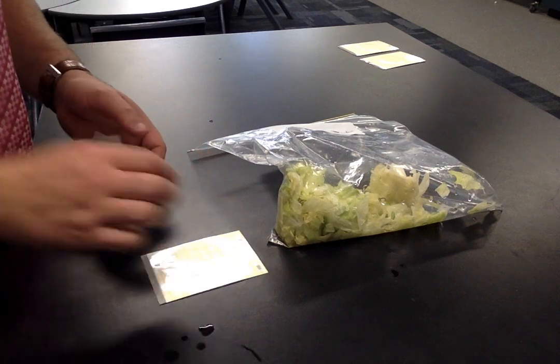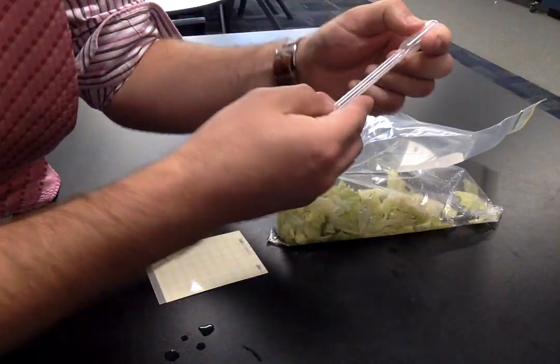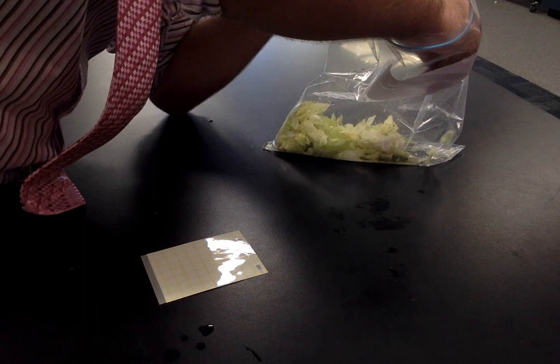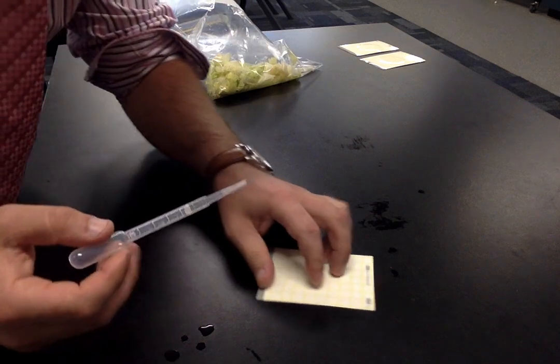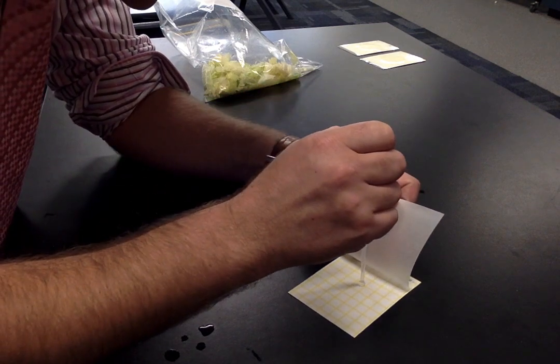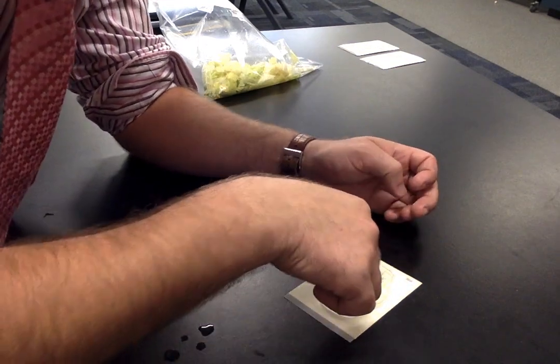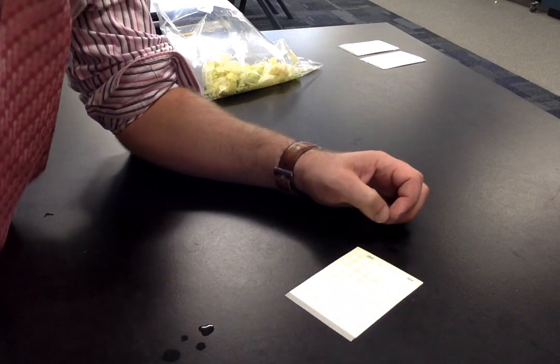Stick our label on. Get a third new pipette — we've got our 1 ml mark just here. The process is the same as with the previous two. I'm going to try and centre that water as best I can; it just makes things a bit cleaner and makes counting a bit easier.